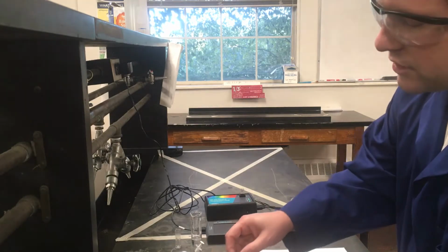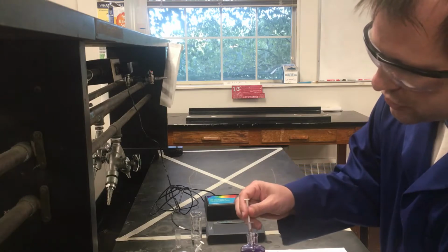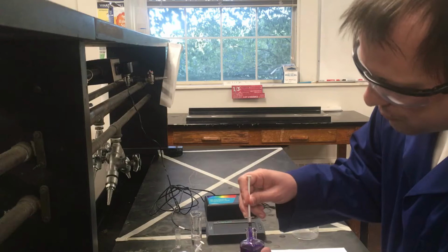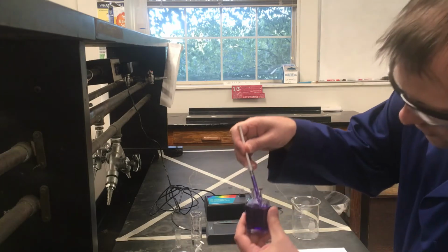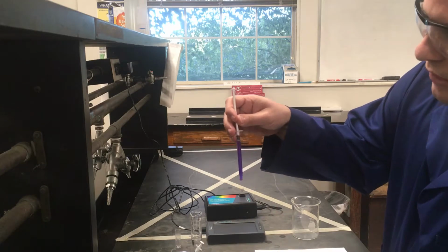So how I'm going to be measuring things out, this is how we make all the measurements in this lab. We're going to be using these little syringes, which have nice little markings on them that go up to a maximum of about 1 milliliter. I'm trying to get a reasonably accurate measurement here, and I'm going by where the actual liquid level is in here.